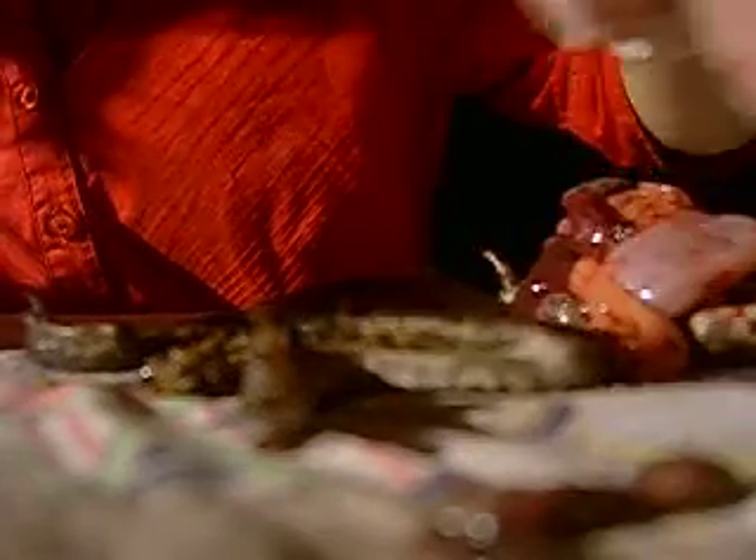They're babies. Are they actual babies or just eggs? Just eggs. There's a lot of eggs in the sac. There's different coloured eggs — they're females. This is the female. There's white and black eggs. Isn't that the egg sac right there?